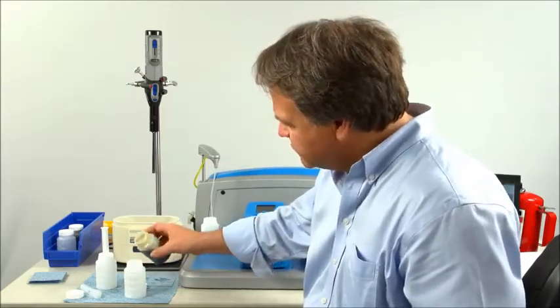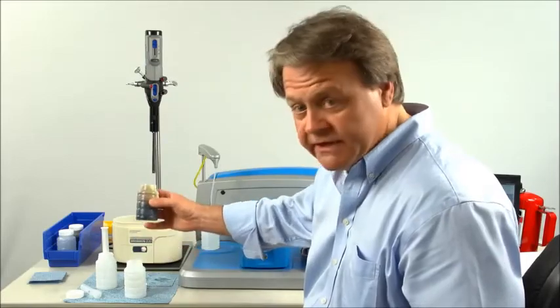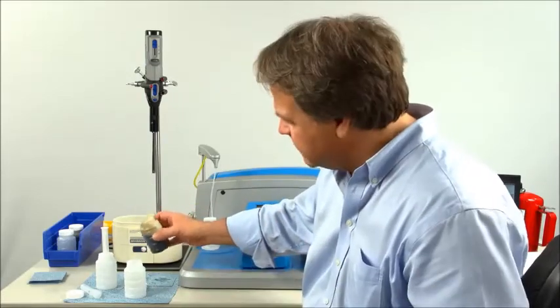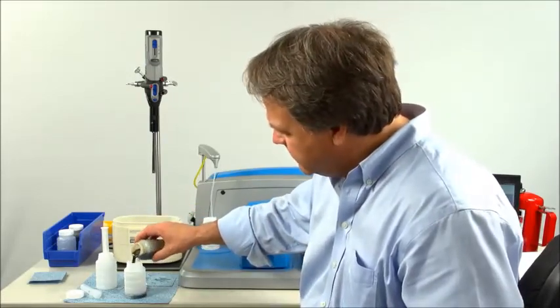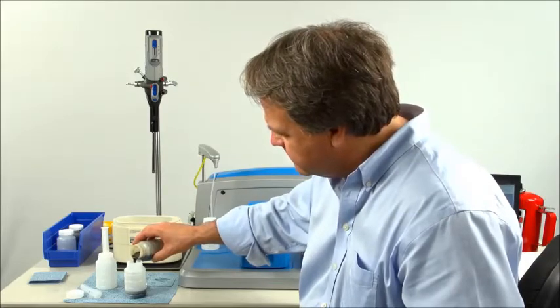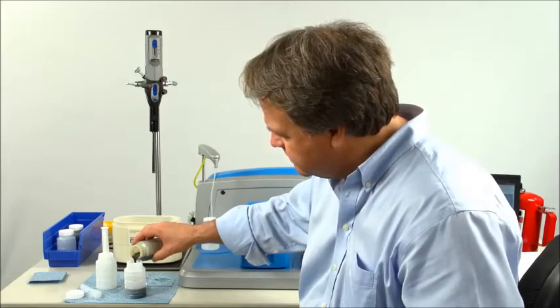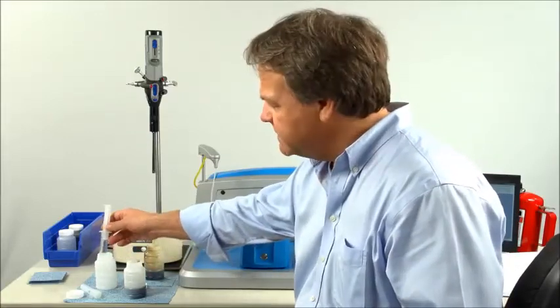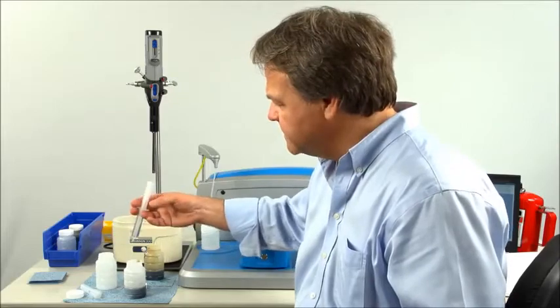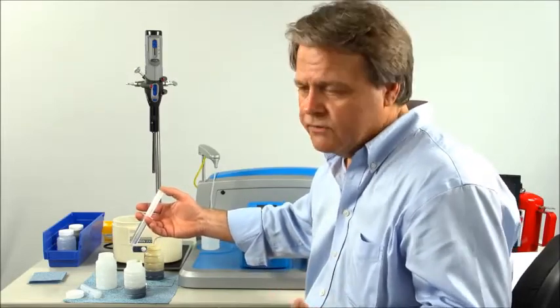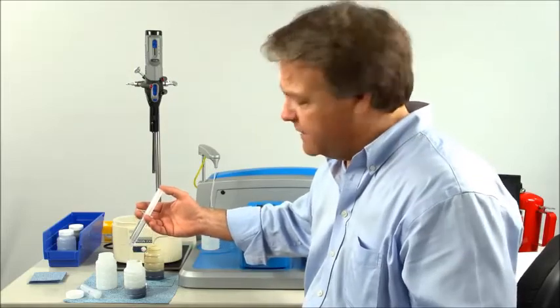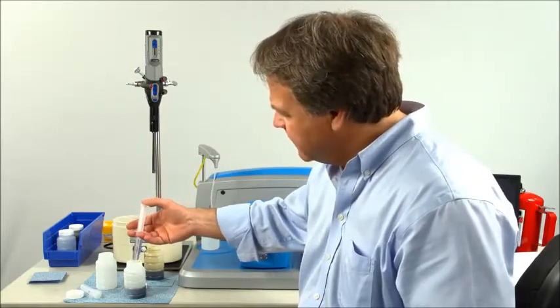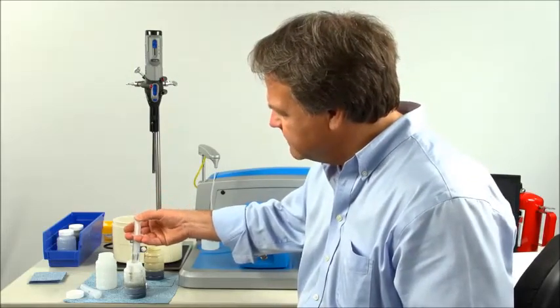If you're using dilution with the sample, the straightforward way to do it is: after you've shaken the sample to disperse the particulates, decant to the second line of the bottle, then take a syringe with 10 cc's of solvent such as lamp oil, kerosene, Electron 22, or really any traditional lab solvent, and inject your 10 cc's.